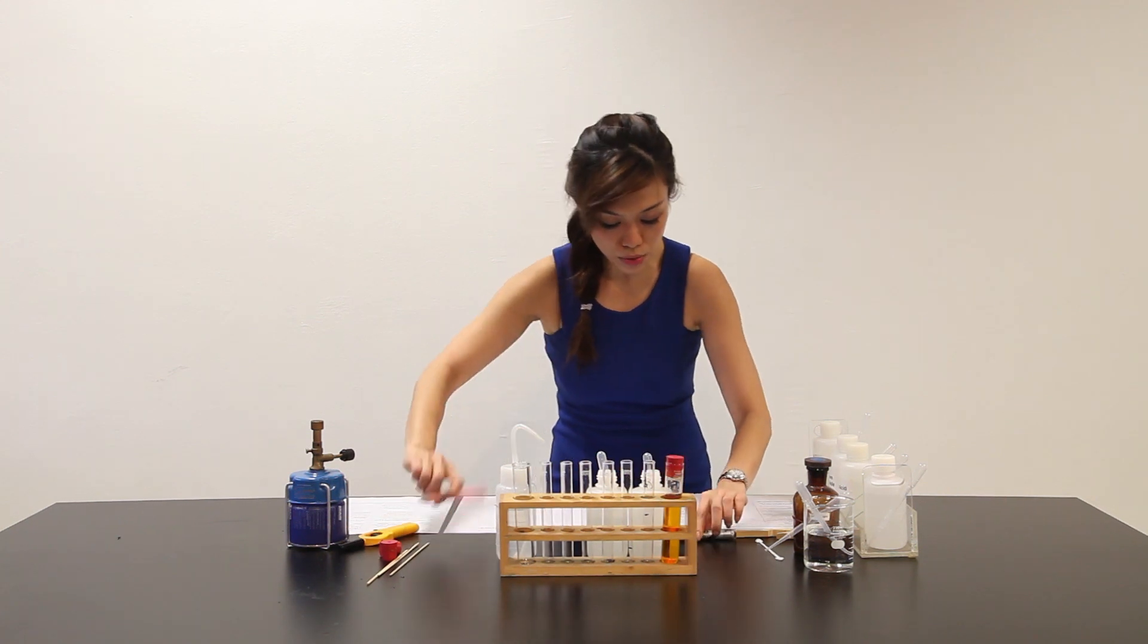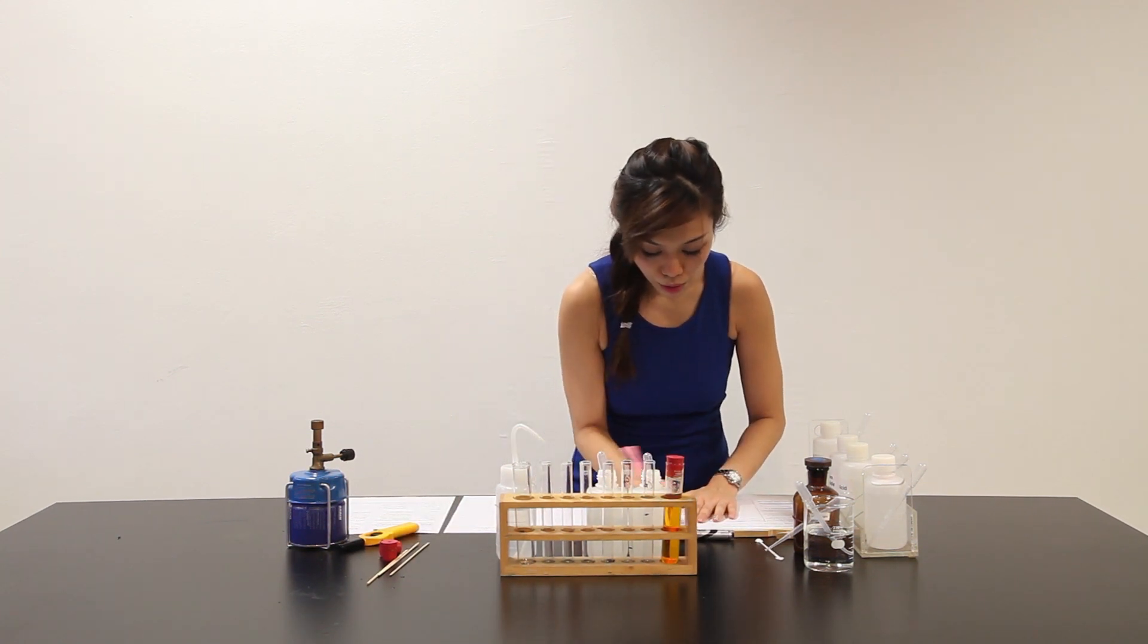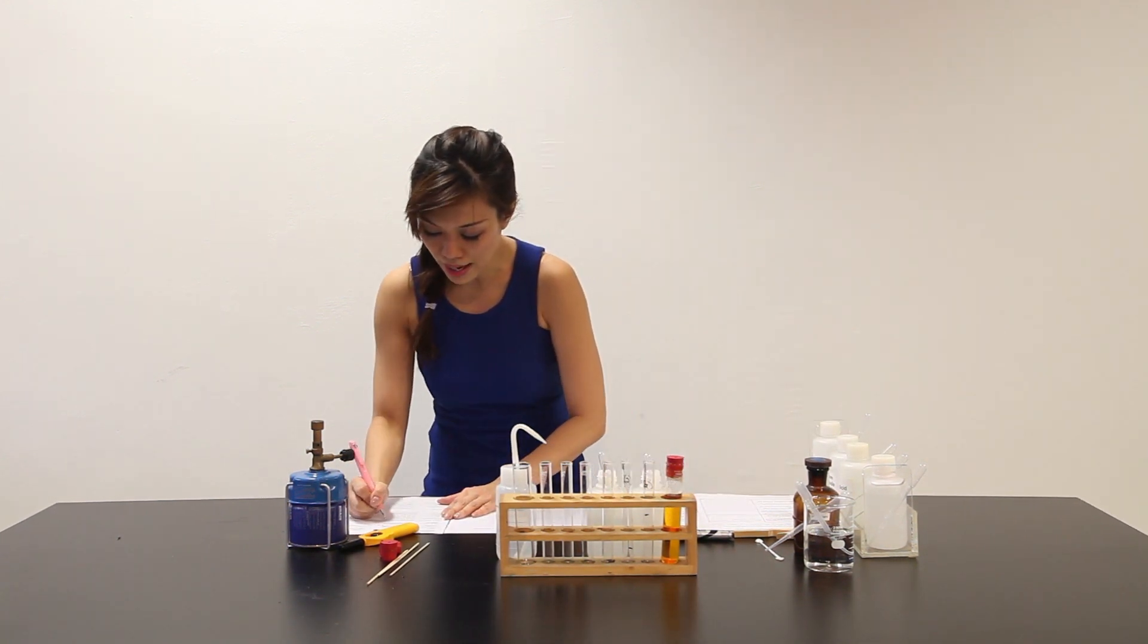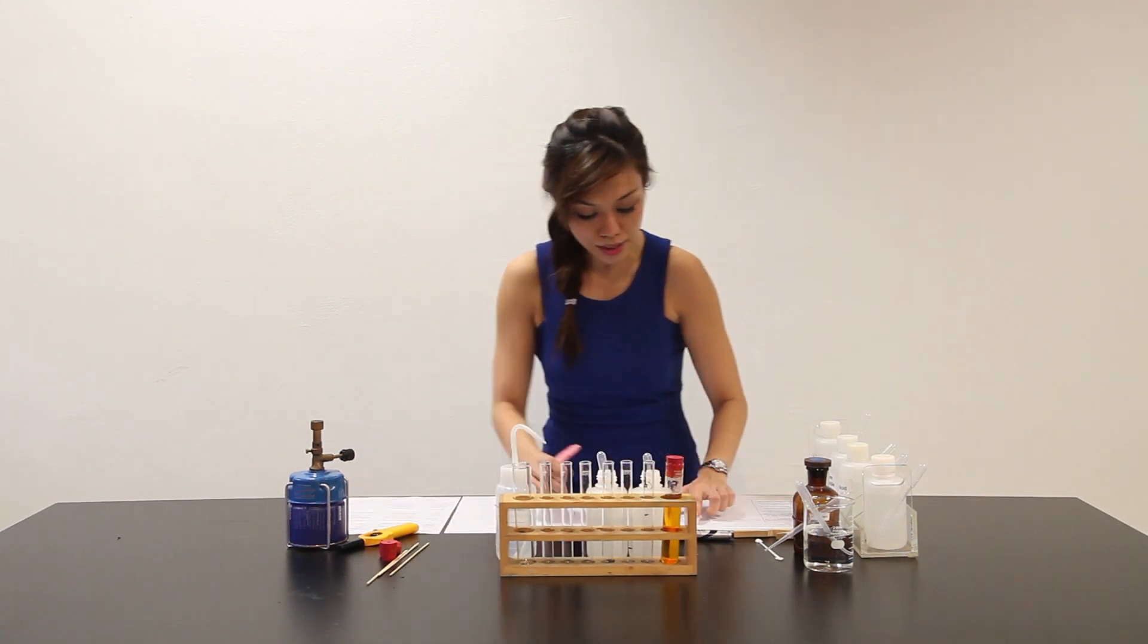Now, when sodium hydroxide is used, we have to refer to the QA notes. QA note says that it is a test for cations. So, I will see the colour change from here.